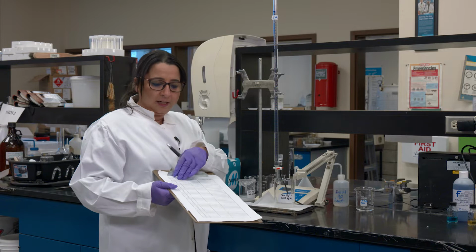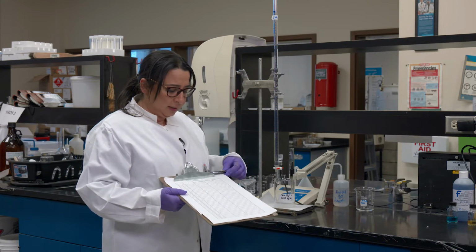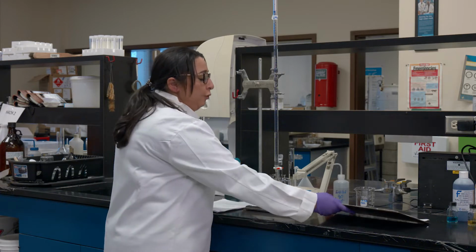By the way, I will be sharing this data with you eventually, and you will have access to it. You will be treating this data further to perform some calculations, and we will be graphing this data to find the equivalence point and the half equivalence point, which give pK1 and pK2, which will further assist us in calculating the concentration of carbonate and bicarbonate ions.